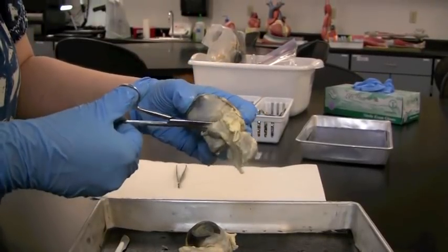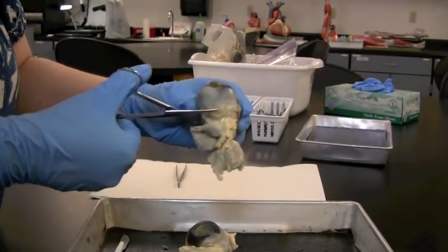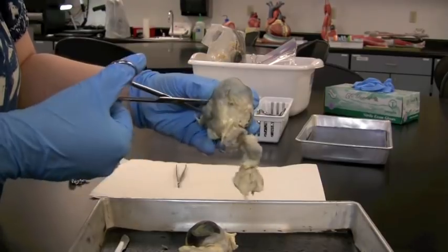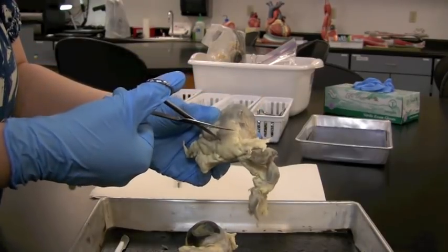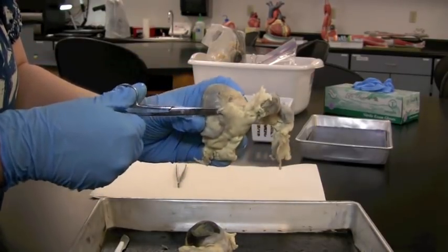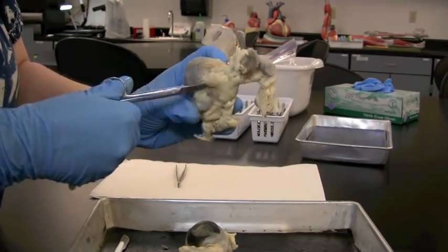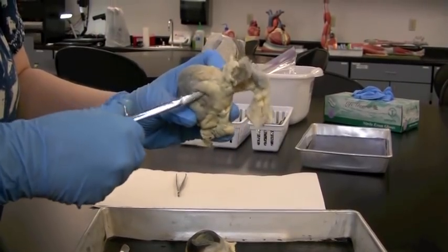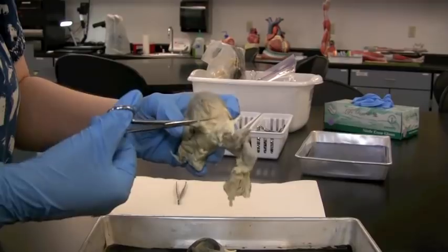I'm just going to clear out as much as I can. I'm going to try not to cut straight through the back though because I want to save the optic nerve. But I'm going to cut all the way around and keep cutting. I will do that and show you various stages.